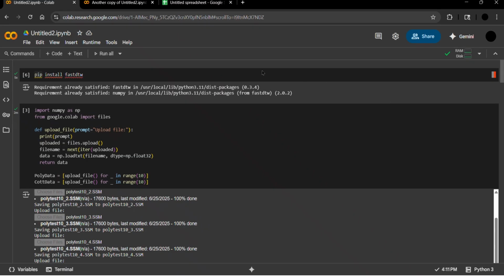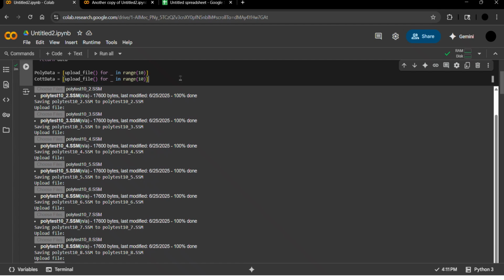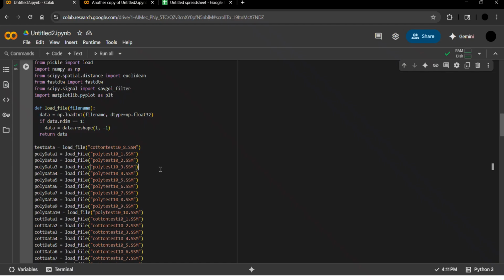Here we have the Python code where the comparison algorithm is run. In this file, it'll be run against polyester and cotton data. First, taking the external dynamic time warping library that's used for the comparison, which everything here is done in the Google Colab environment. First, we upload the data trials of all 20, for 10 polyester and 10 cotton trials, which you can see here. This is all loaded into the code here.